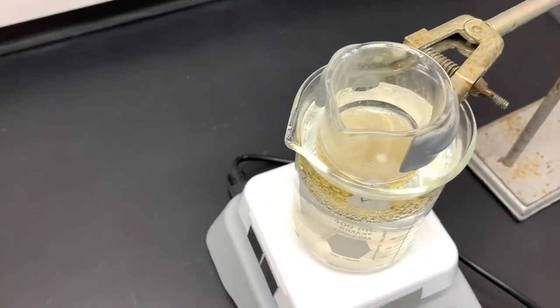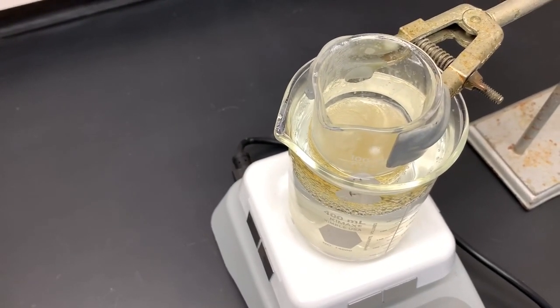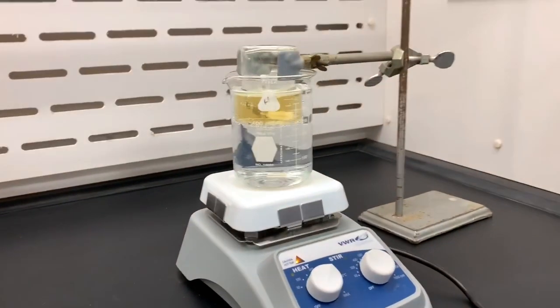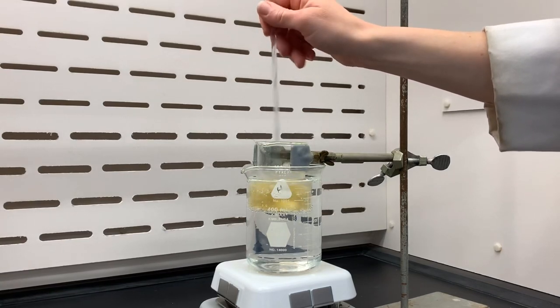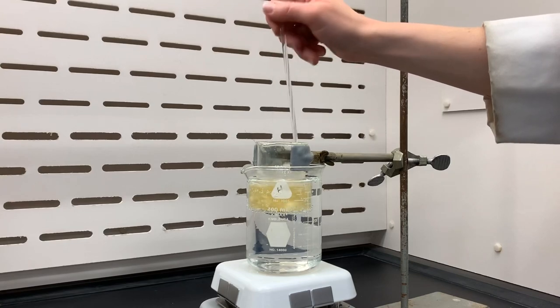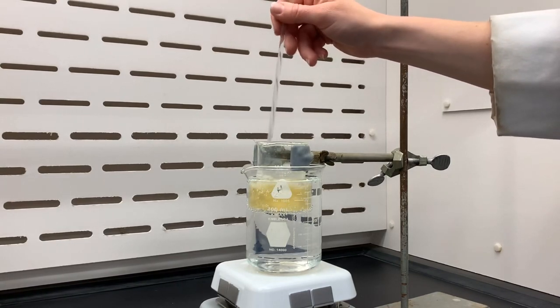Everything is reacting with each other and solid is being formed. You can see the solid film layer at the top of the beaker that contains the reaction mixture. Anytime a mixture becomes heterogeneous, it's always a good idea to make sure that it's mixing well. Sometimes you might want to use a stir bar to mix any solids that are forming, just to make sure that it is all a homogeneous mixture.